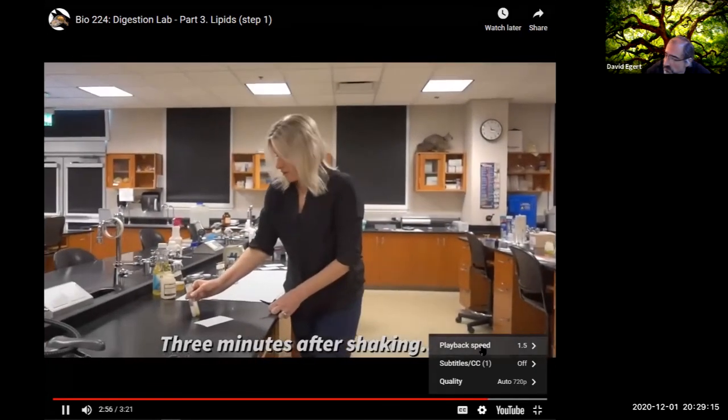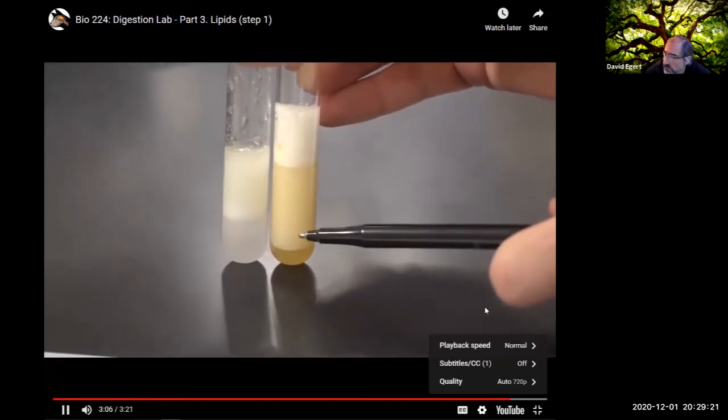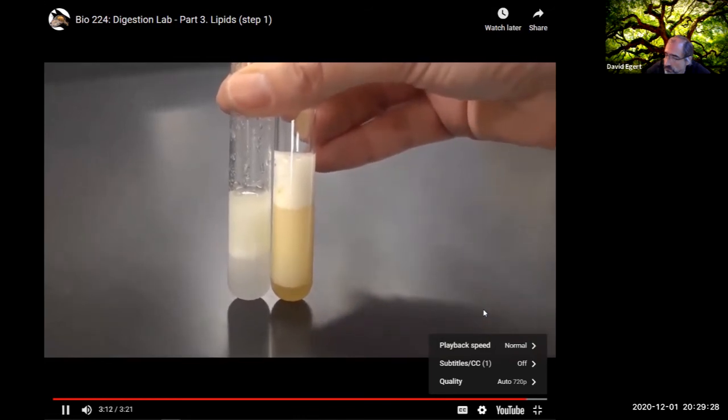All right, so after 3 minutes, we can see that we have water and oil separating in test tube A, and in test tube B, we see an emulsification layer here in the middle, and then water down at the bottom, and then we have some foam up here at the top.